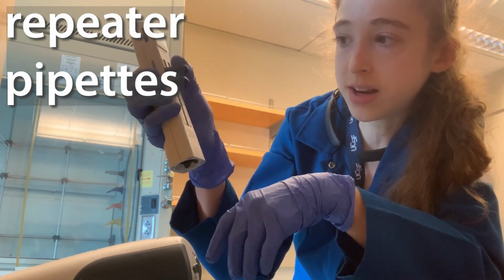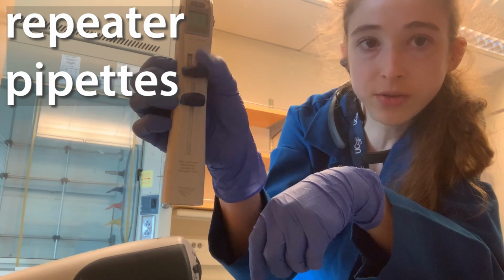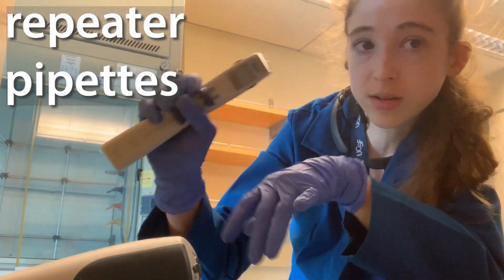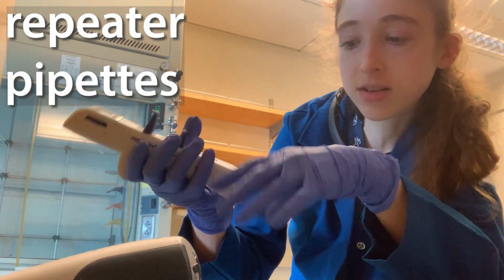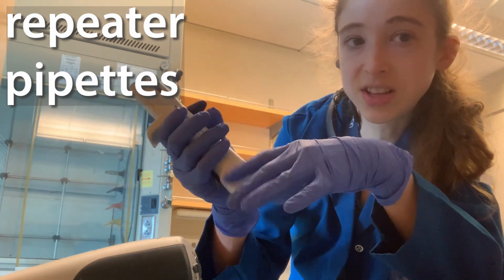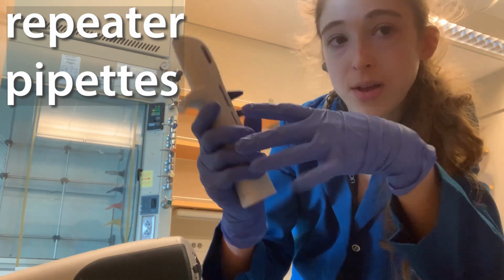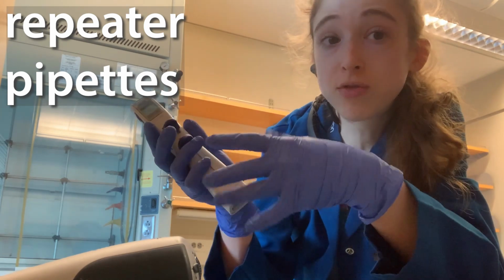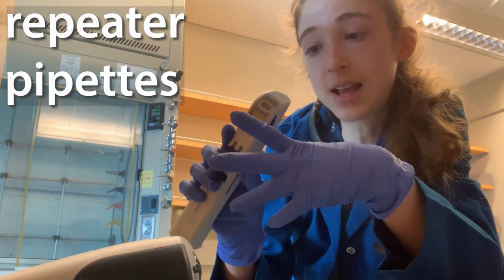And then you go down, down, down, and each time you go down, it's going to go down by a set amount. Don't trust that first little bit, so a little bit just excess after. Also be aware that at the end there could be bubbles, so when you pull up, you typically want to make extra so that you don't have any bubbles, and then your last release will still be good. If you've drawn up some bubbles, then you could have problems with that last release.